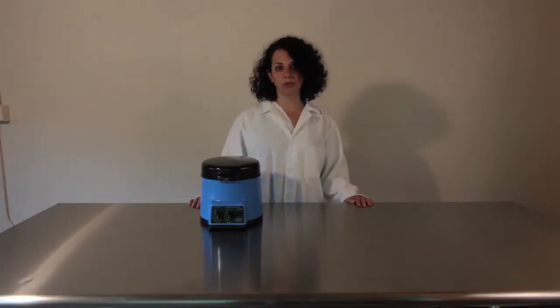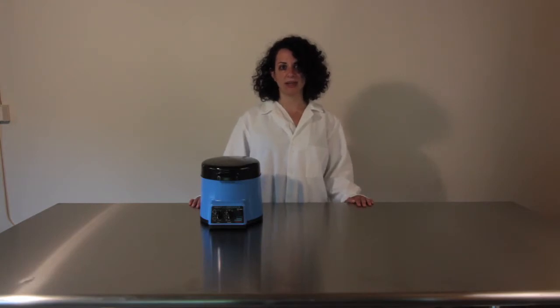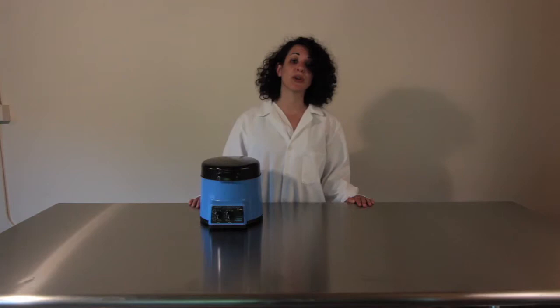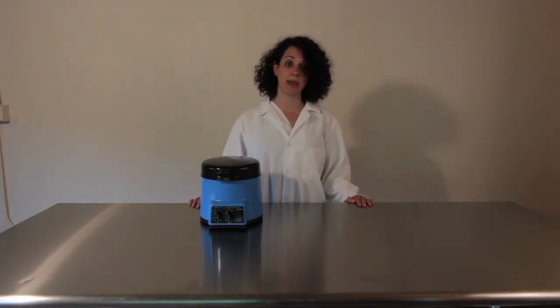The Bullet Blender is a great tool for lysing cultured cells. This process can be carried out on any model Bullet Blender, but in this movie we're going to use the BBY24M, or the Bullet Blender Storm, which homogenizes samples in microcentrifuge tubes.